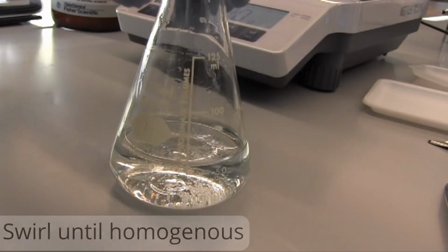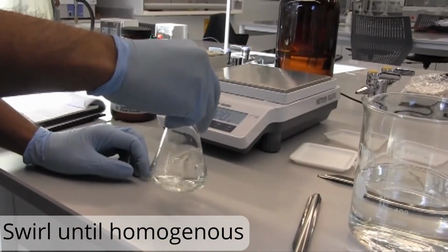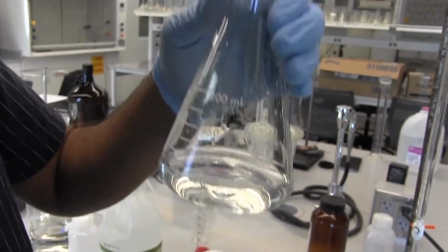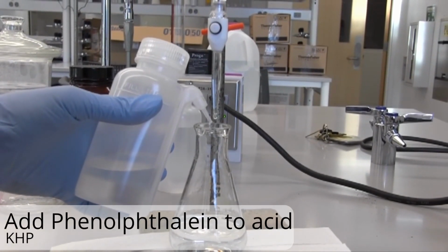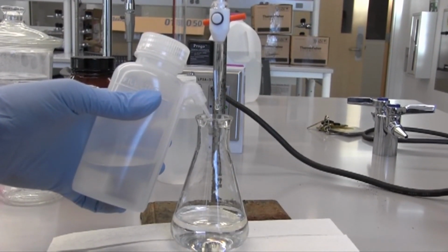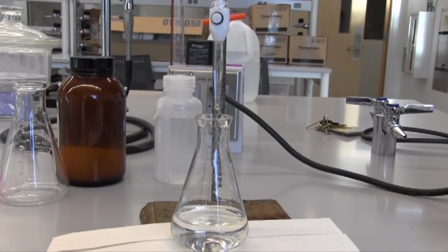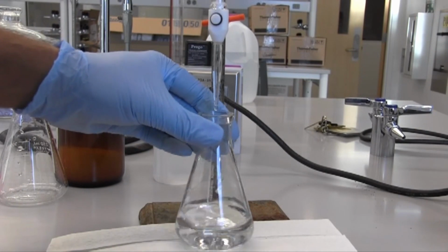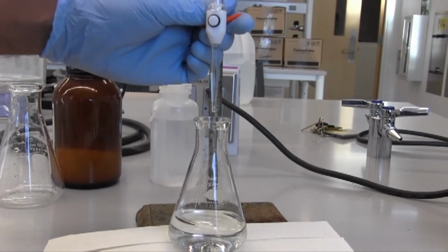Now we want to homogenize this mixture, so we're going to swirl until all of those crystals dissolve, as you see here after some time. Perfect. We'll then go ahead and add our phenolphthalein to this solution. So phenolphthalein is our important indicator. It is what actually causes a color change when we raise our pH. So right now, the pH in this solution is very acidic because all we have is our acid.